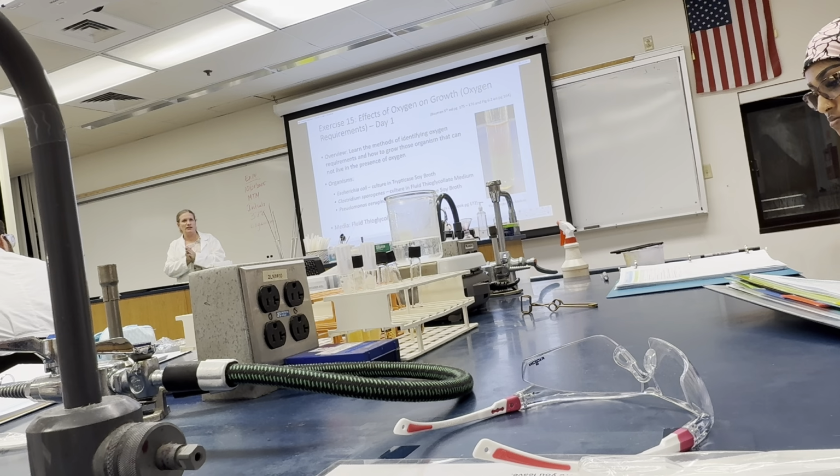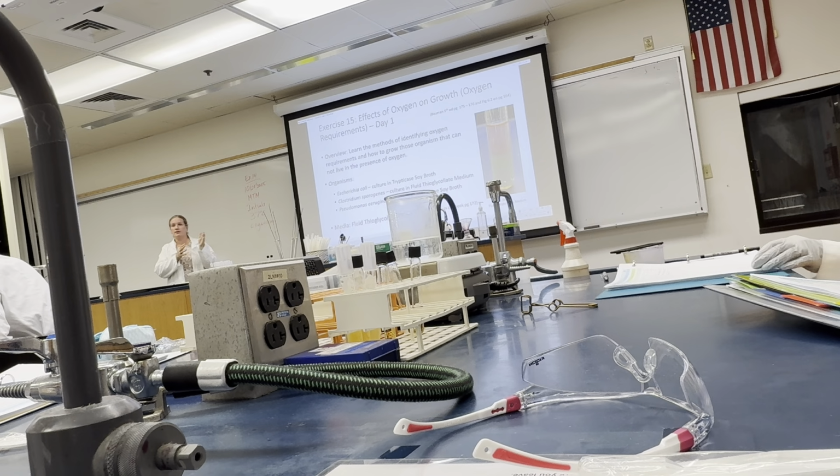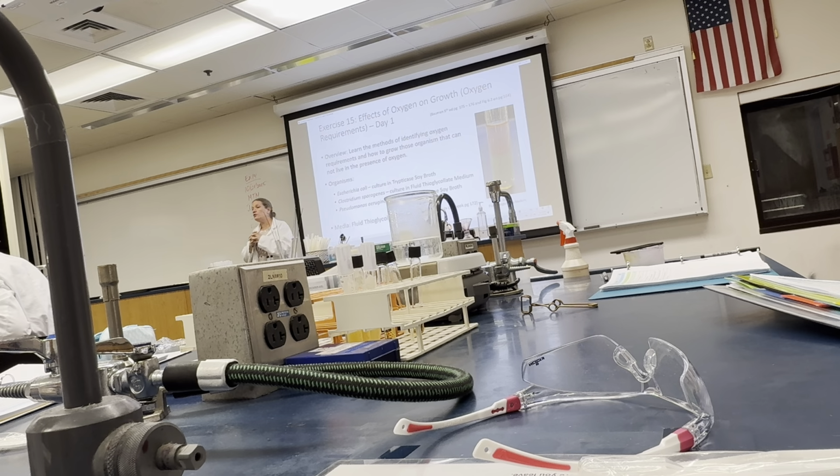Okay? Don't tell me. Every term, even though I say don't tell me, somebody will say, oh, because you want to sterilize it. It's already sterile medium. It doesn't have anything growing in it. So boiling it had nothing to do with removing contaminants, sterilizing, or anything like that. It was sterile before you put it in that water bath. You're only putting it in that water bath to force out oxygen. Right before we start using the test, we want to force out all the oxygen. Now, are we cooling it?